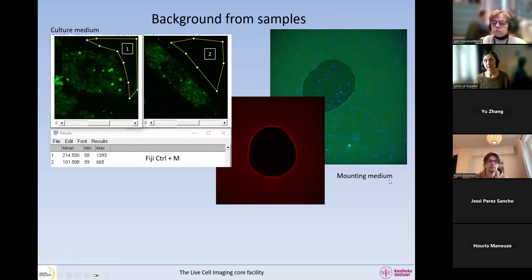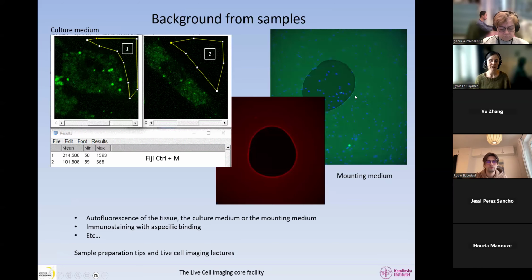As we have seen several times when you guys come to me with the student imaging challenge workshop, the mounting medium can be fluorescent. And you can see it when you have a bubble. If you see the bubble, if you're focused, you can focus on this bubble with transmitted light. And then you take an image in fluorescence. If you see this, it means your mounting medium is very fluorescent. If your mounting medium is not fluorescent, you do not see a difference in intensity between inside the bubble and outside the bubble. Okay, so here is another example of fluorescent mounting medium.